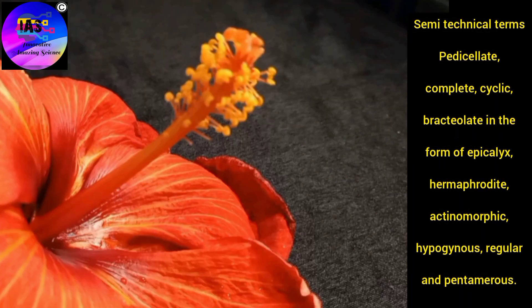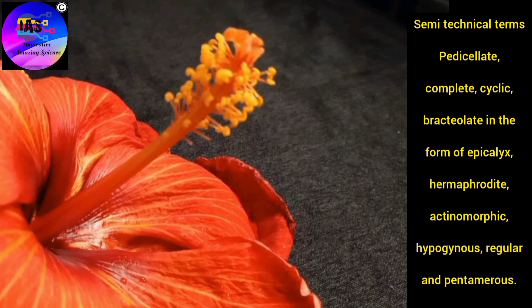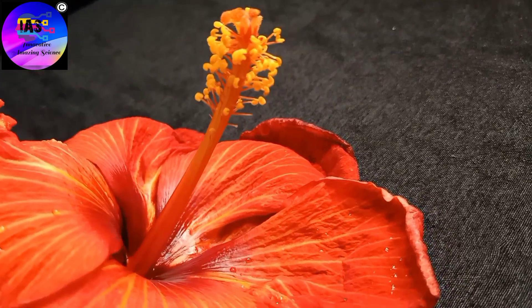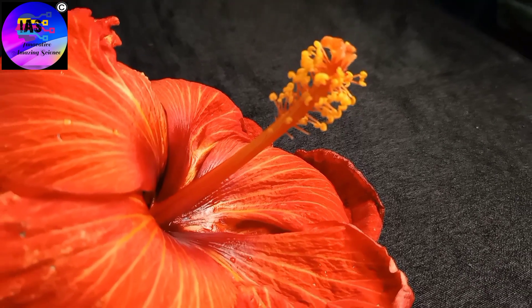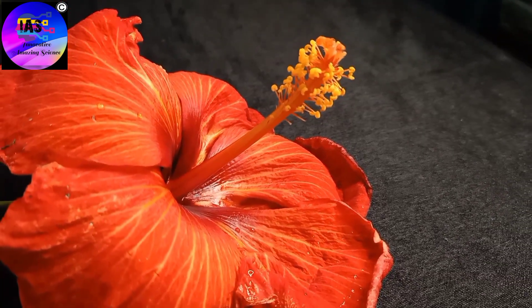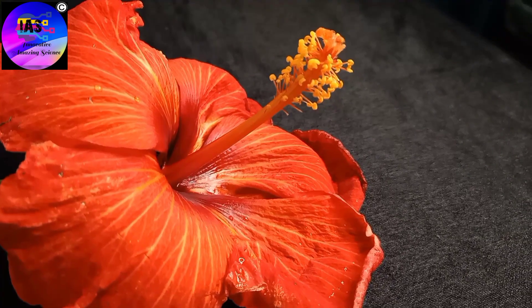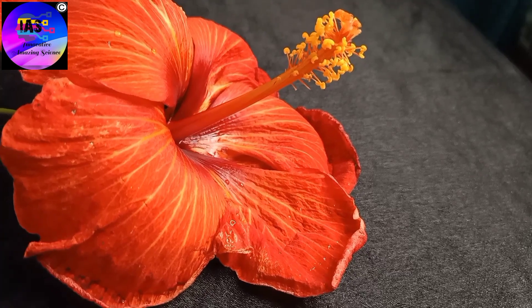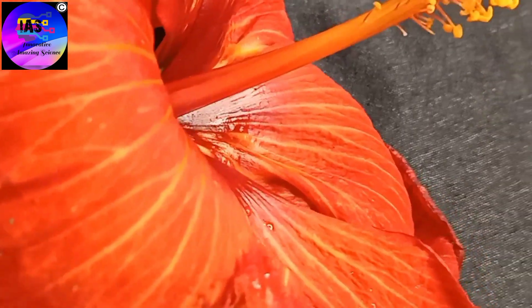Some technical terms have been introduced, so now let's start with our dissection of the flower and understand each part in a more hands-on way. You can see a beautiful hibiscus flower here. Hibiscus is a genus of flowering plants in the Malvaceae family. You can see the stalk and the complete flower. This flower is a complete flower because it contains all four whorls: the sepals, petals, the androecium, and the gynoecium.